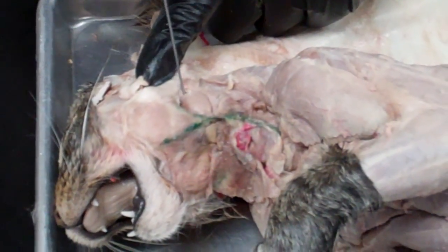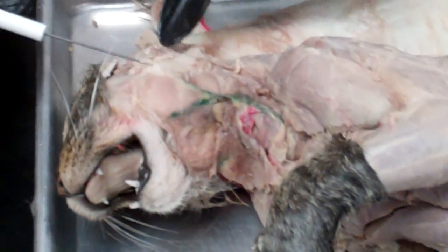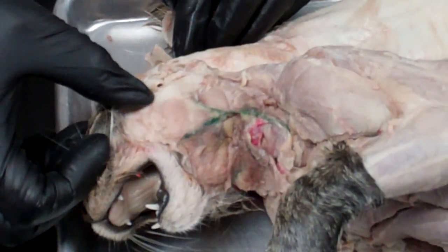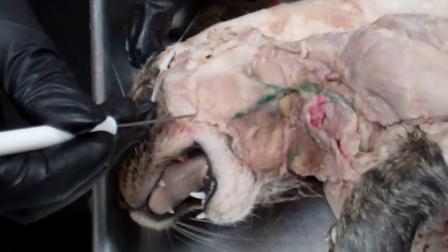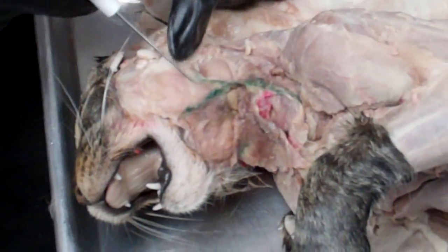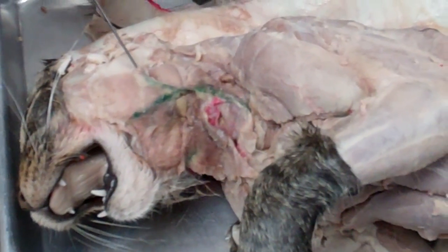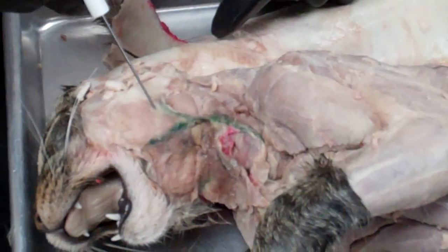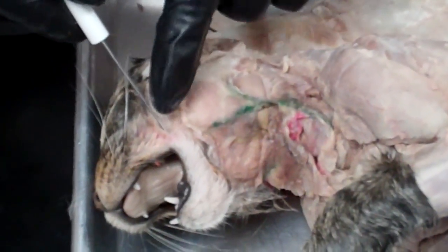This structure right here is fairly easy to identify — this is the submandibular gland, and the parotid gland is this one right here. There is a duct coming from the parotid gland that runs along here, but that won't be required for identification. Right down here in this area, where this white structure is, is the sublingual gland — the posterior facial vein runs right across the sublingual gland.